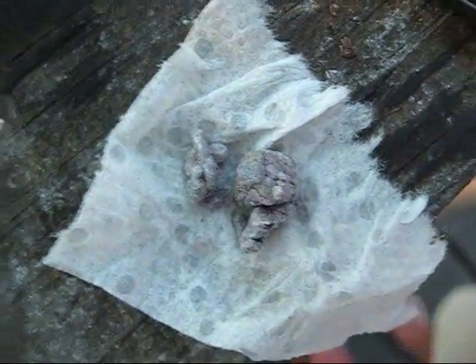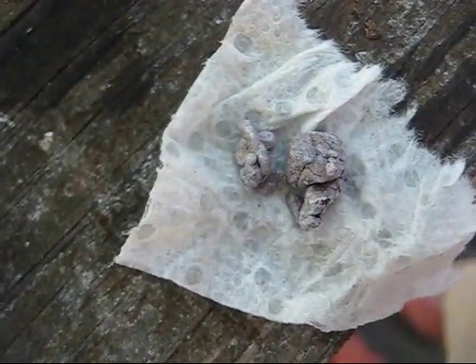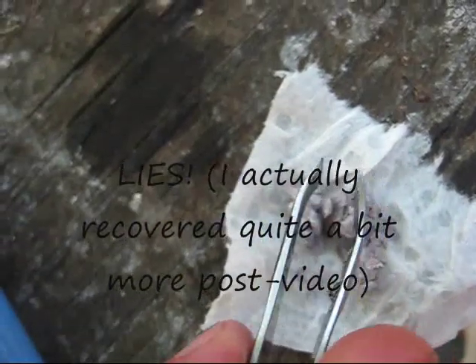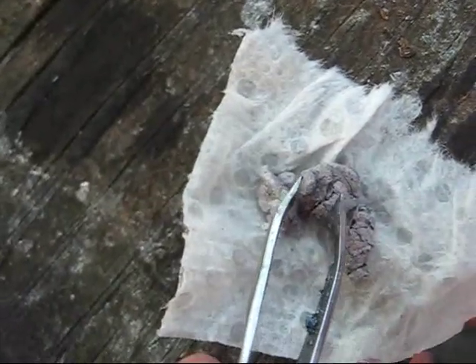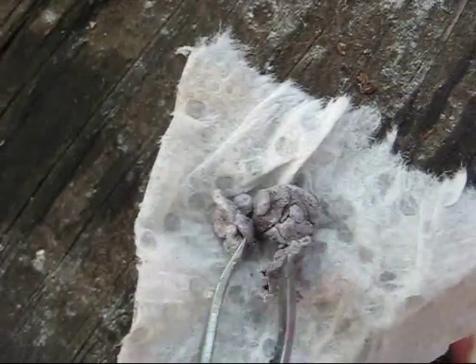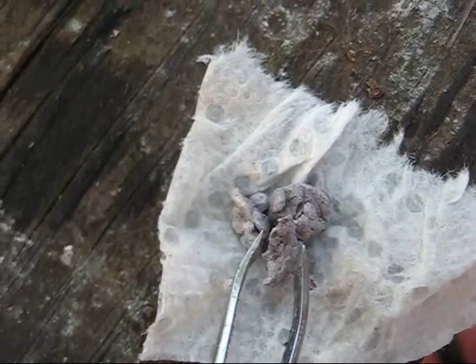After using a good portion of this for testing, this is the leftover sodium I have. I'd estimate it to be about a gram or so, but it is sodium separated from the slag. So I've achieved my goal for today, and I guess I'll catch you next time. Bye.